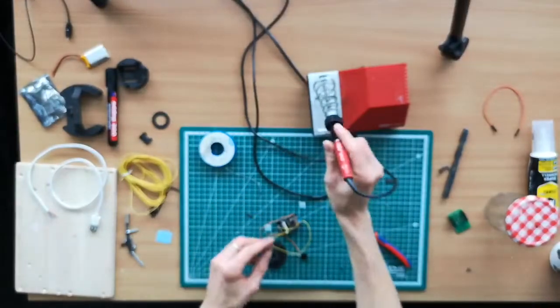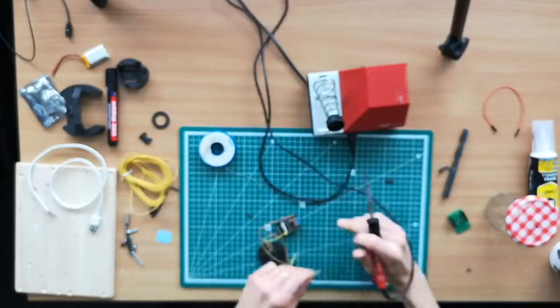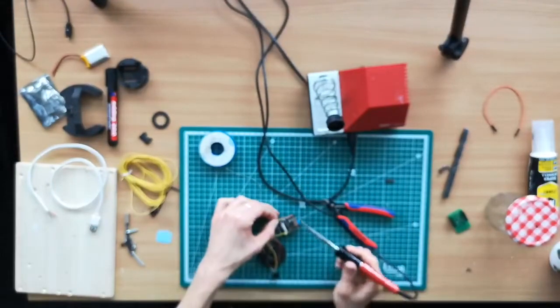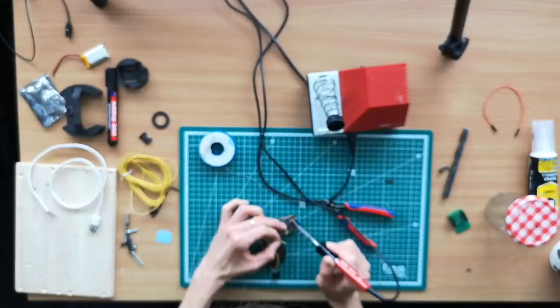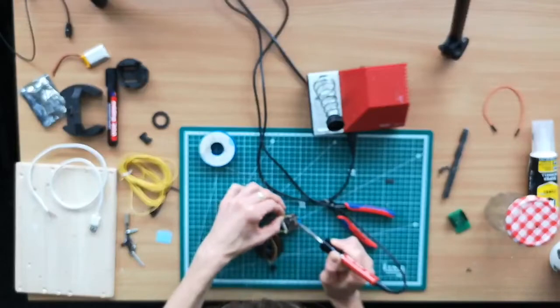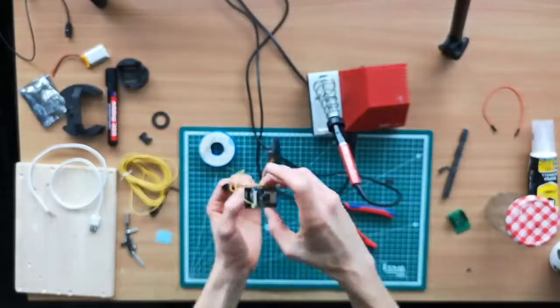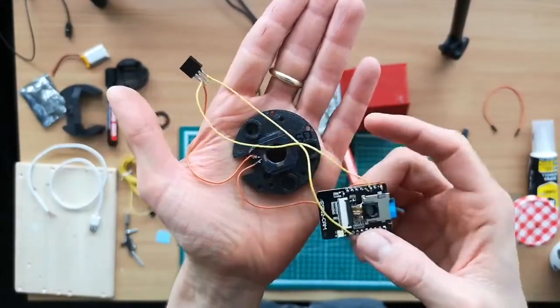Which is number 12. So you add some lead again, make sure the pin is clean, and then you add that to 2, 14, 15, 13, oh, that's already a shortcut, number 12. That's pretty much it now. And so 12 goes to the base, and then you amplify the signal for the lens.